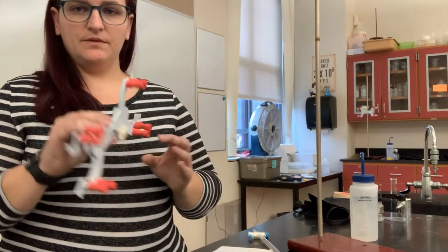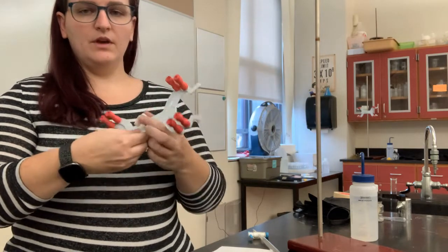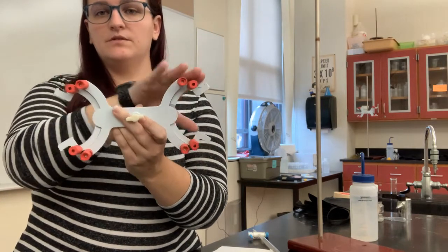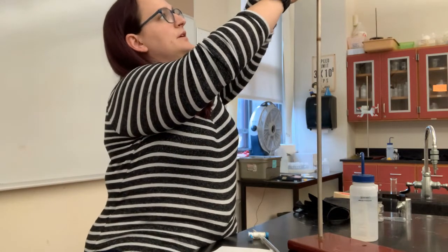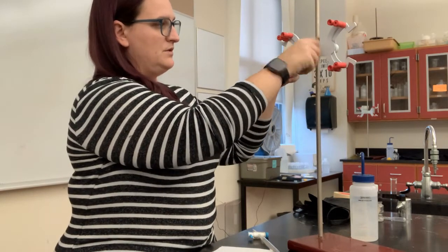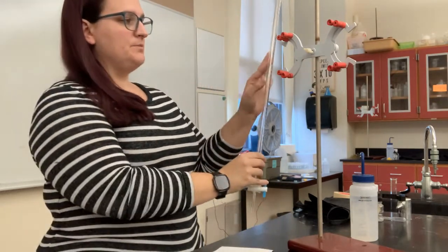First, I'm going to demonstrate the setup of the equipment for this procedure. So in using a burette, it is hooked up to a ring stand to keep it upright. So we use one of these clamps to hold it to the ring stand. The center of the clamp goes over the pole, and then these little parts on the side are for holding burettes. So each of these clamps can hold 2 burettes. We're just going to be using one side. So I can put this over the pole, tighten it at a comfortable height, and then I can attach my burette.